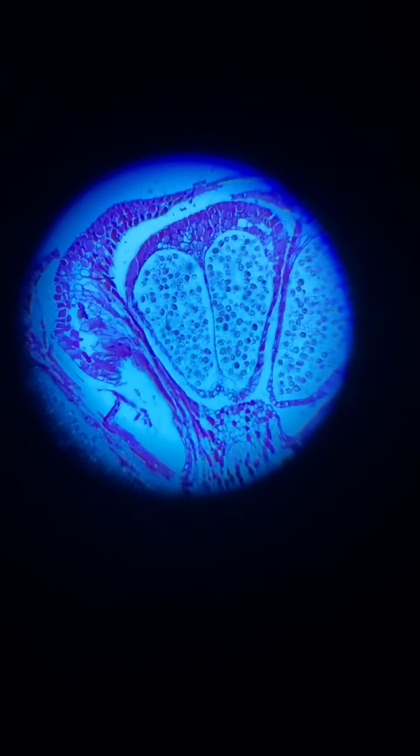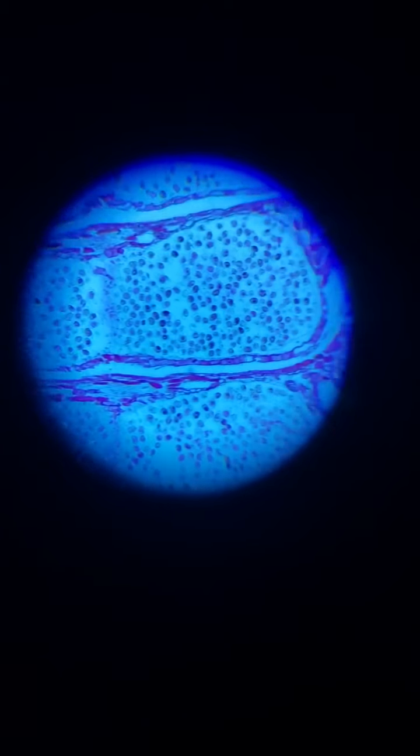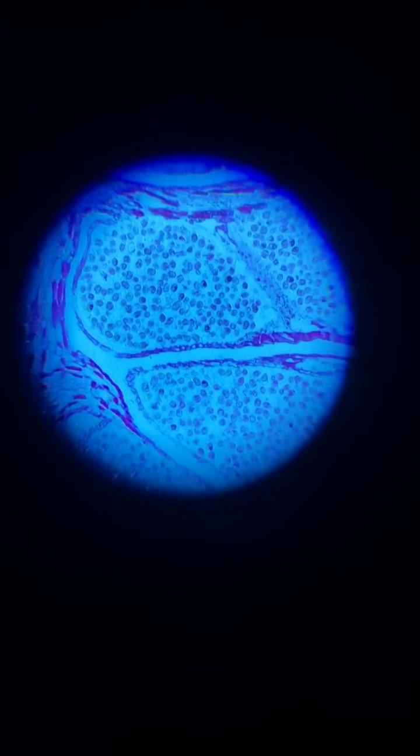So this thin cross cut of a plant, and you can see as we move over here, there's going to be a lot of different types of cells, and it's going to be arranged. Do you see here? There's like this very fine arranged system that plants have.